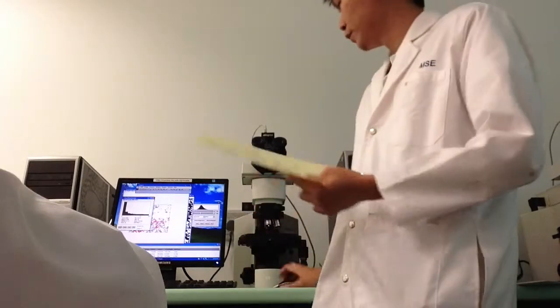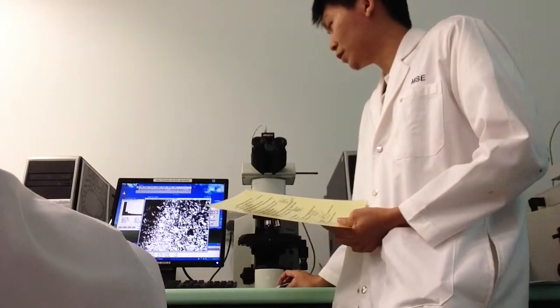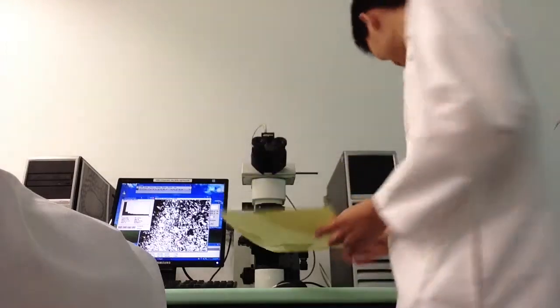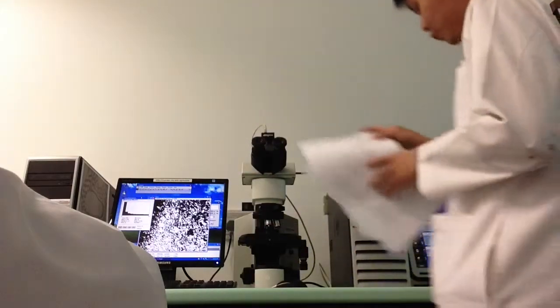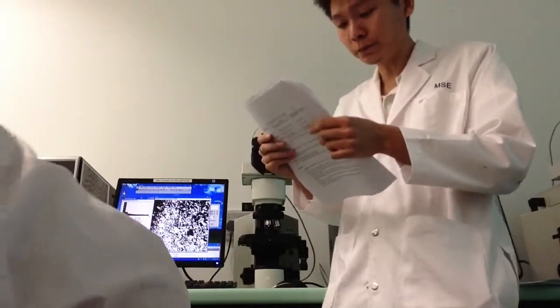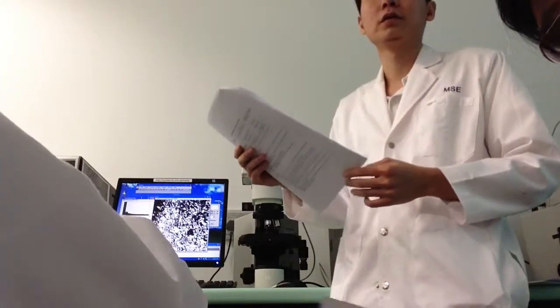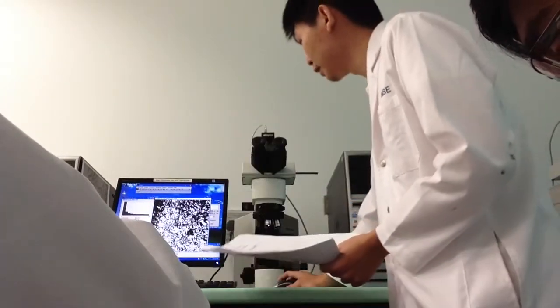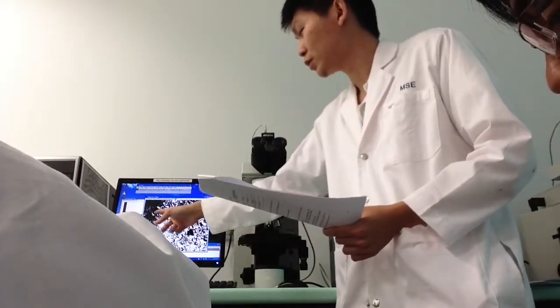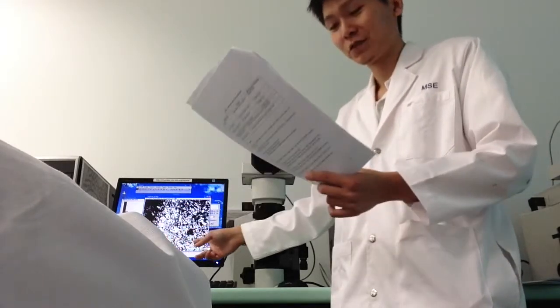Okay, so if you realize, all the answers for question number 1 is looking back at you. If you go back to your log sheet, number 1, insert this selected digital photographic black and white image. What we mean by selected is the yellow box. So you can just cut and paste onto your report for question 1.